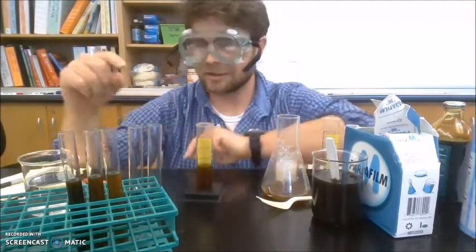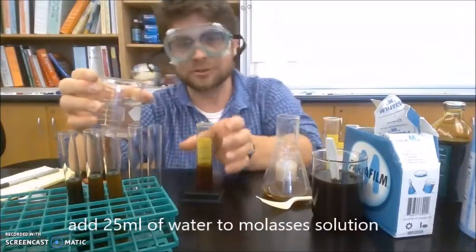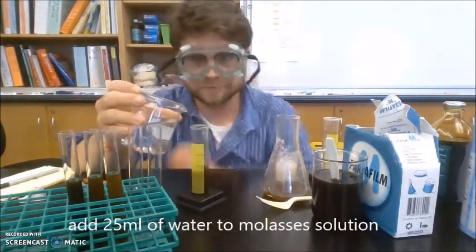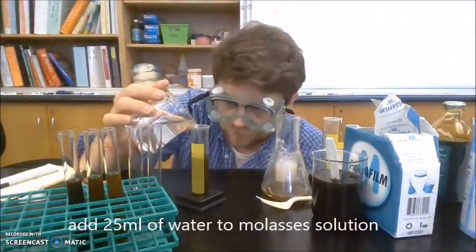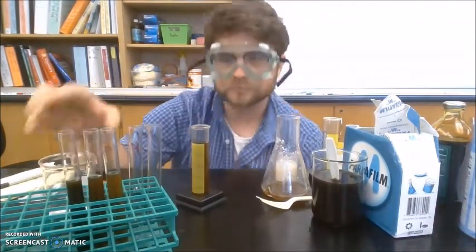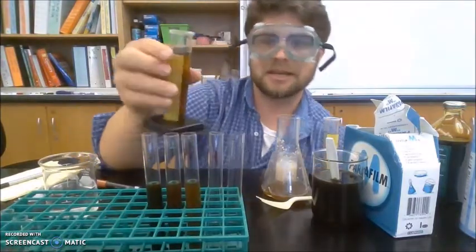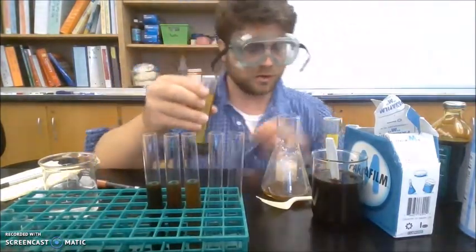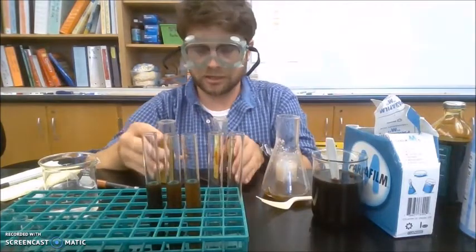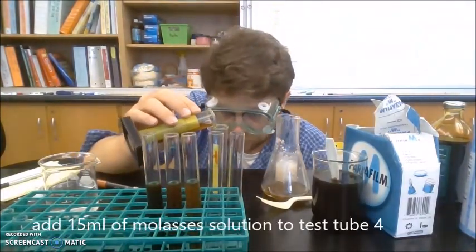And now again, to this molasses water solution, I'm going to add another 25 milliliters. So now let's add 15 milliliters. I'm going to add to test tube number 4.